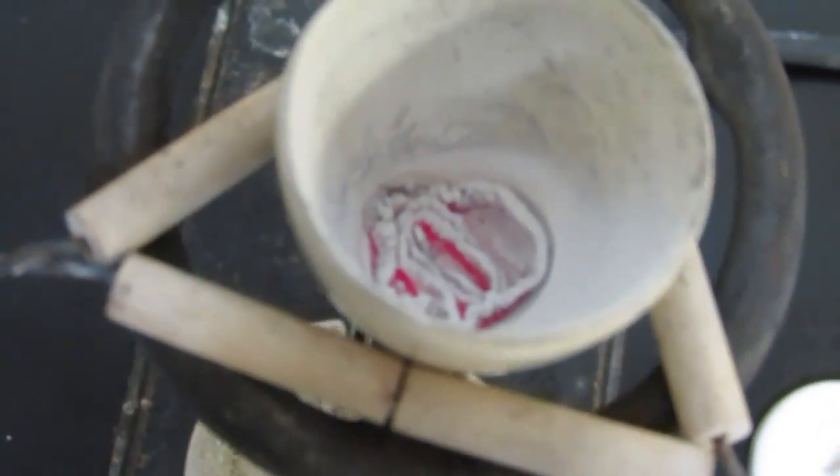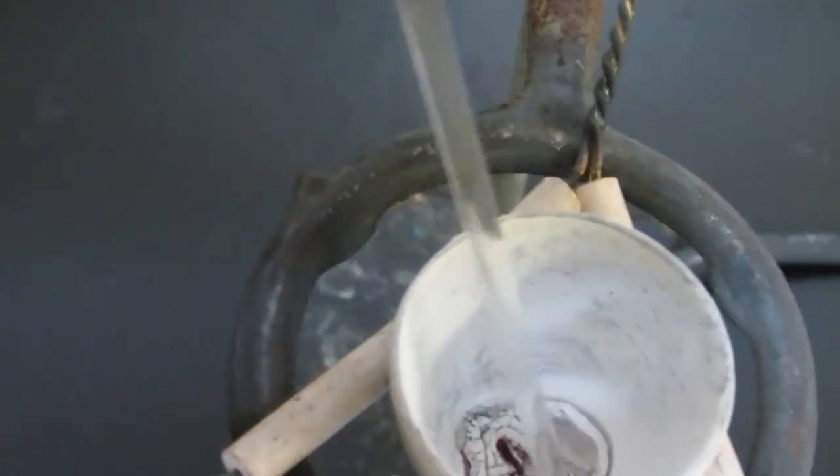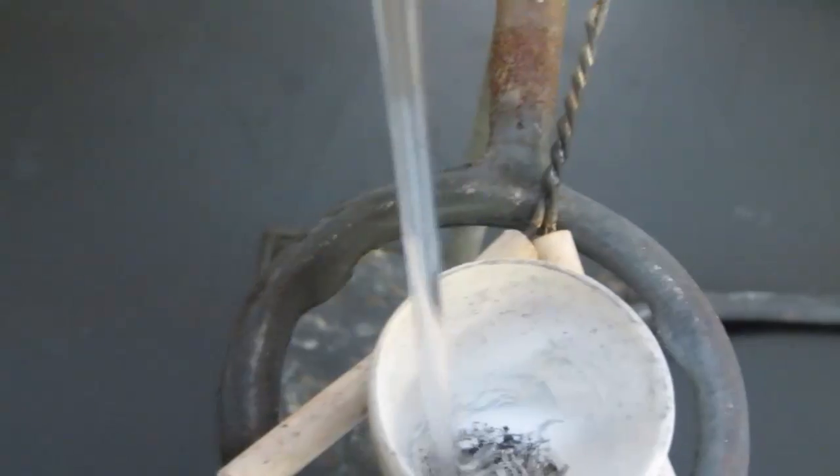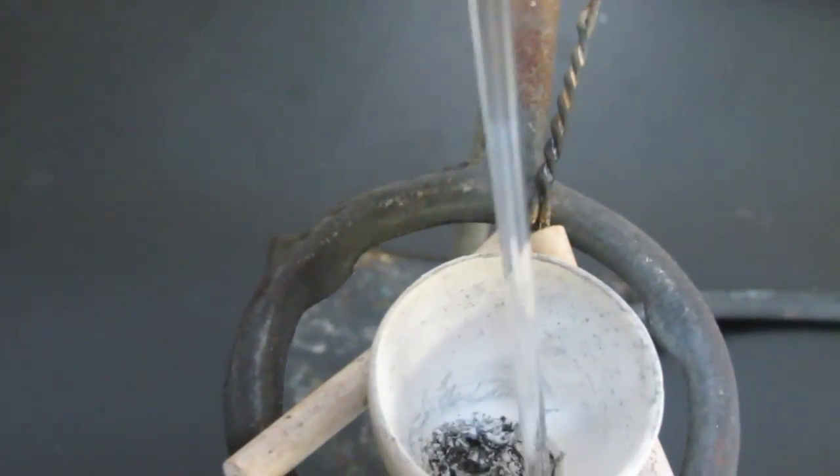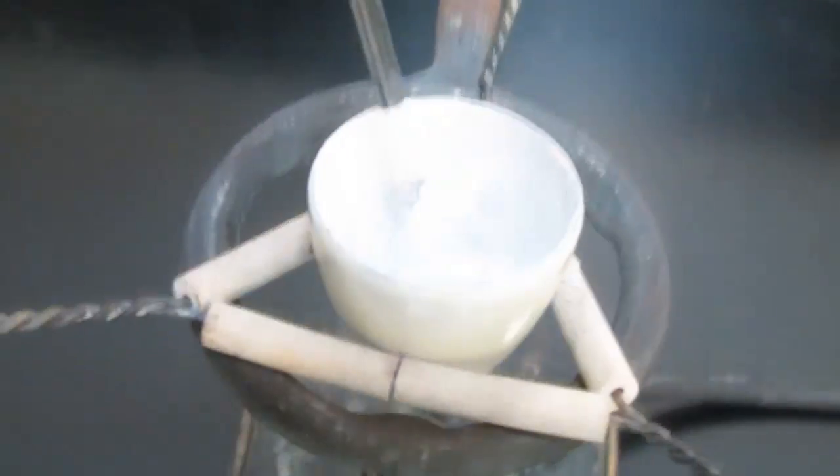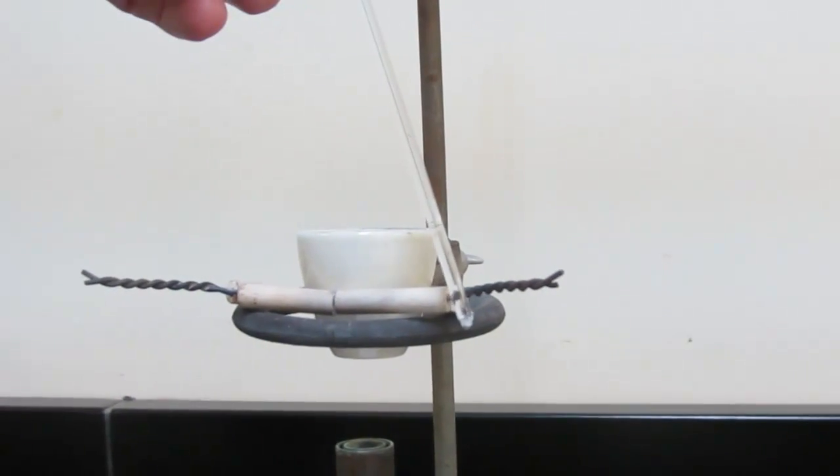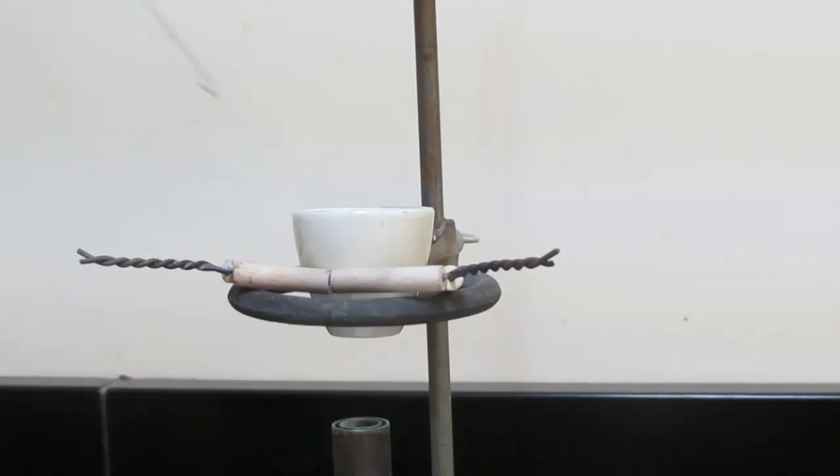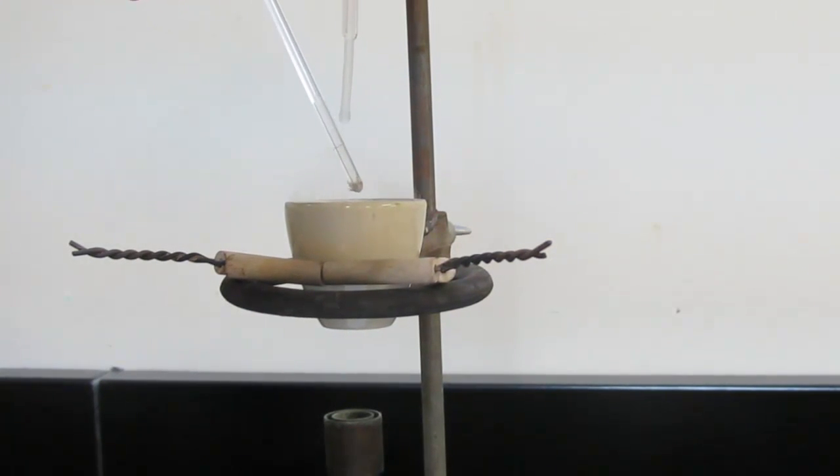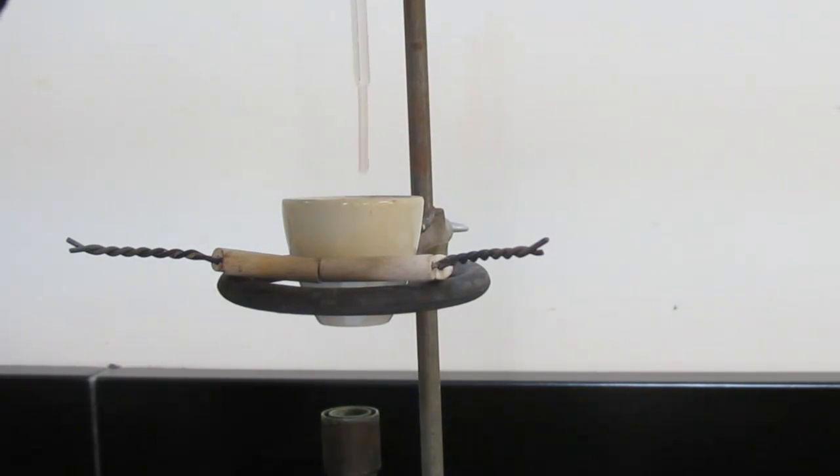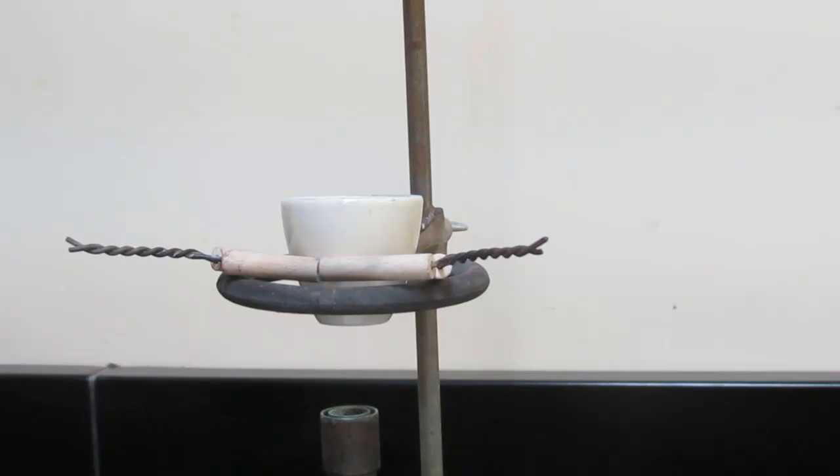Let's take a look and see what we have down there. Okay, you can see the bottom of the crucible is still glowing red. We're going to go ahead and crush this up with a stirring rod here. We have mostly magnesium oxide there. And what I want to do is I want to rinse the tip of my stirring rod off with just a couple drops of distilled water here. So we'll do that, two more drops.